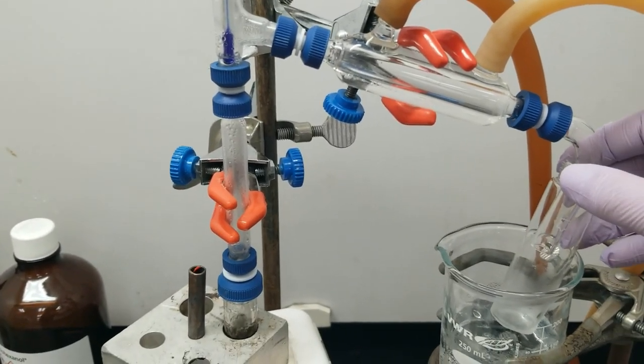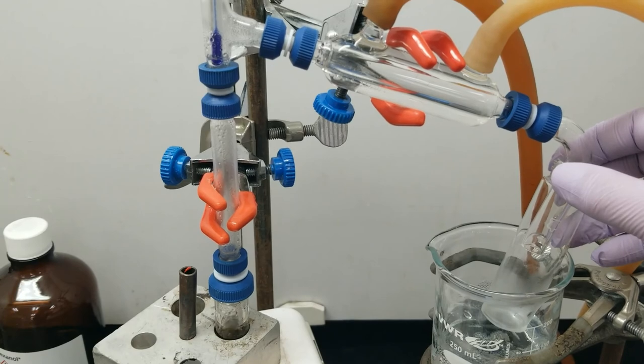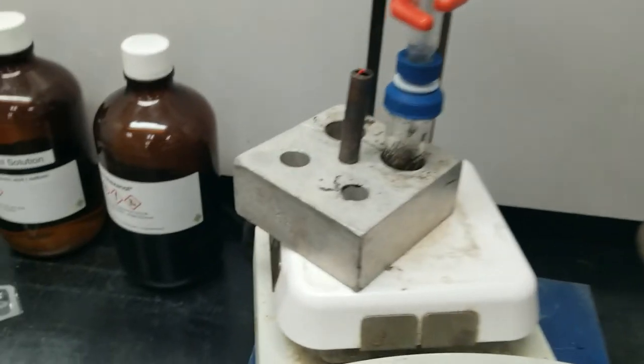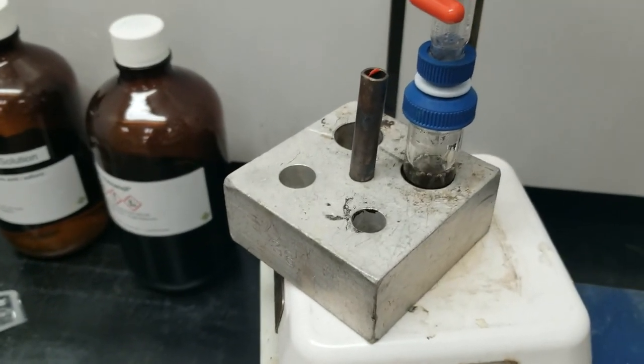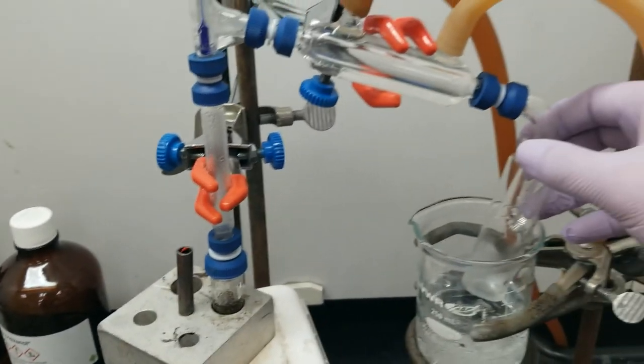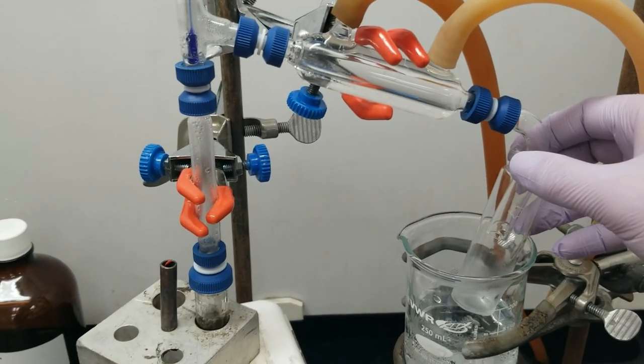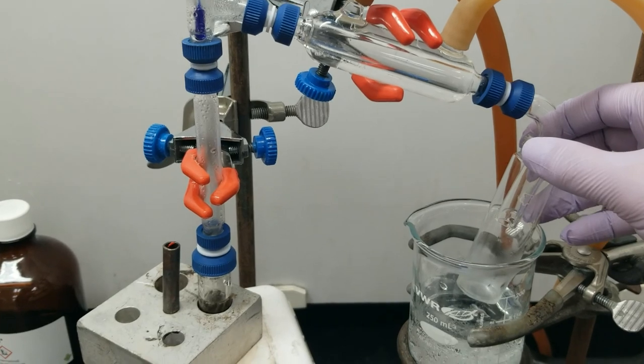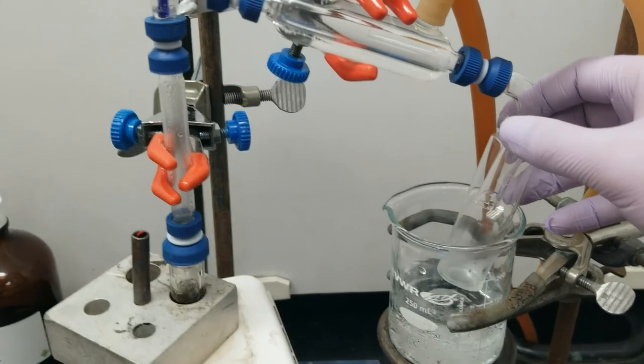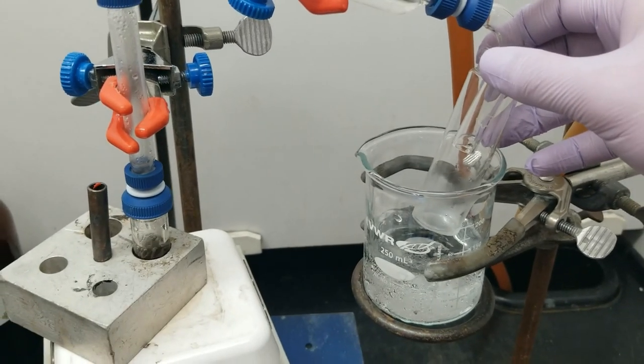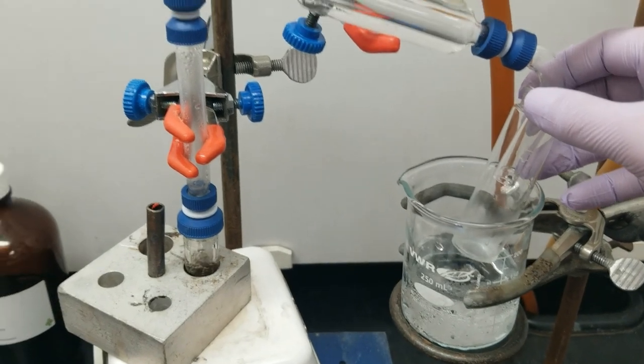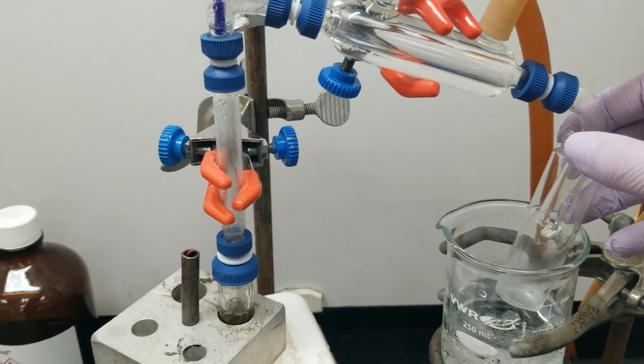So there we go, the reaction is running. I'm going to continue to let this run until almost all of the liquid has left my reaction flask. And this is all going to occur over the period of about an hour. And I will get the data on the product to you guys so that you can fill out your reports. So have a great day and thanks for listening.